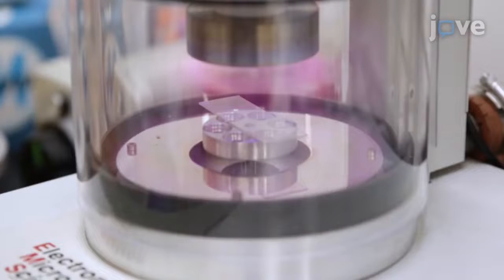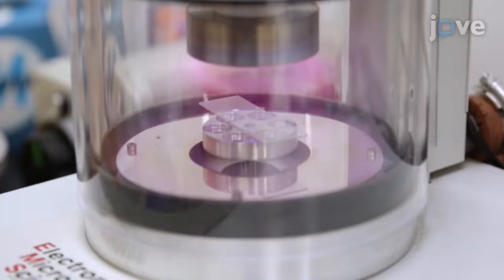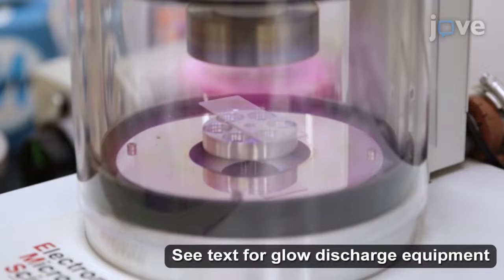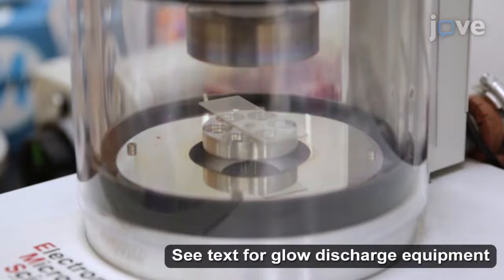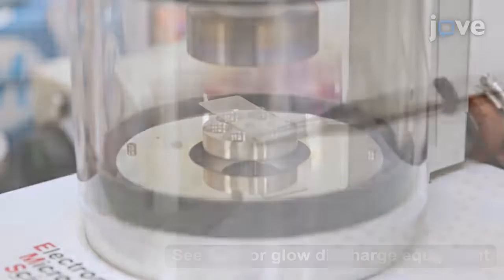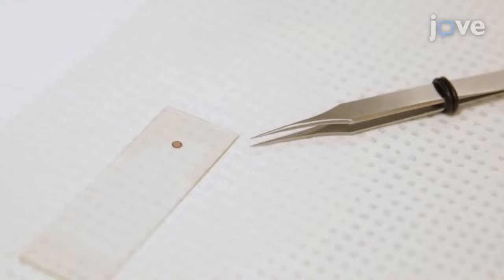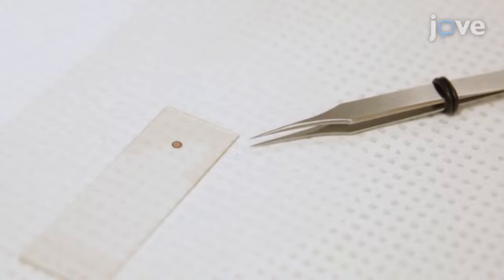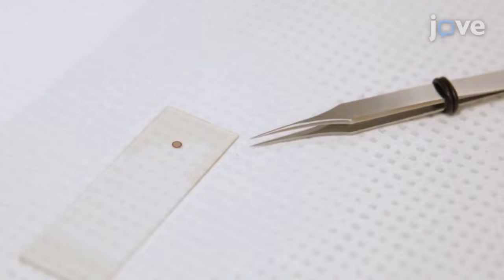Ionize the carbon-coated grids with 40 milliamp glow discharge for 30 seconds to produce a hydrophilic carbon surface. The hydrophilic carbon surface of the grids can only last for 30 minutes after glow discharge treatment.